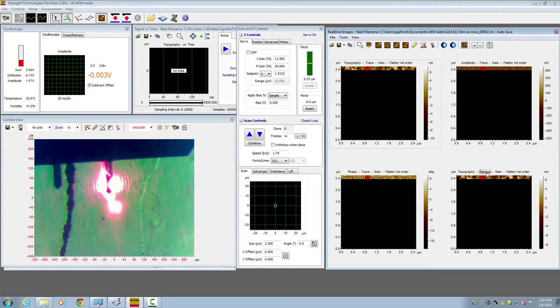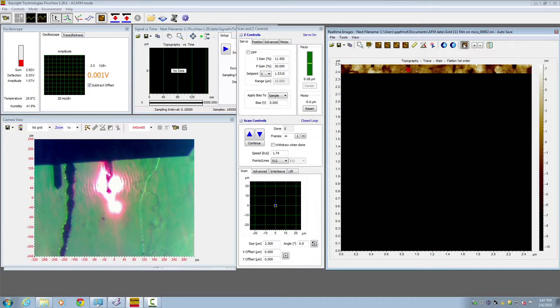In order to see the image more clearly, we could click on the first image, which is topography, and click this button, which will make this image appear to be larger. Let's start imaging. Here the scan speed, we choose 1.7 Hz, and scan size is 2.5 micrometers.